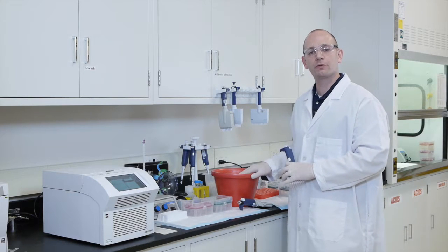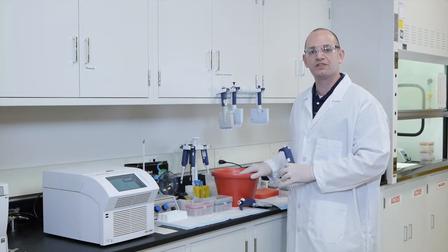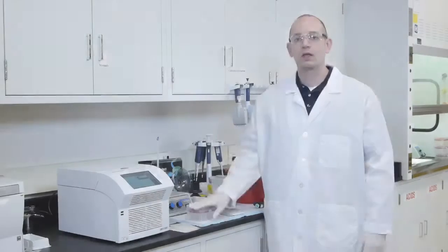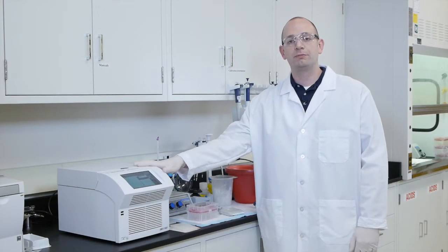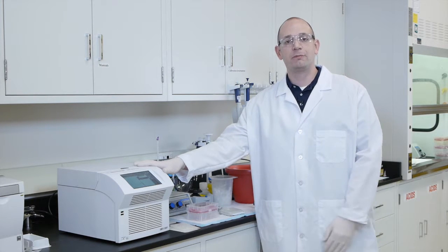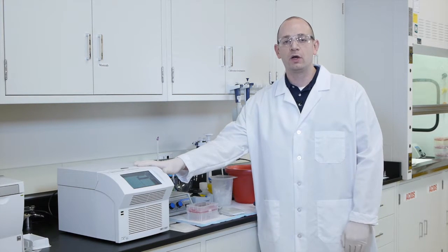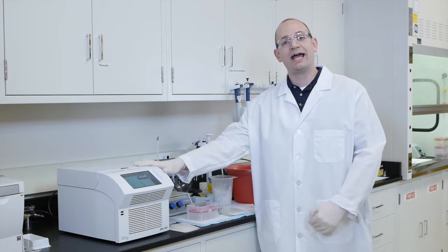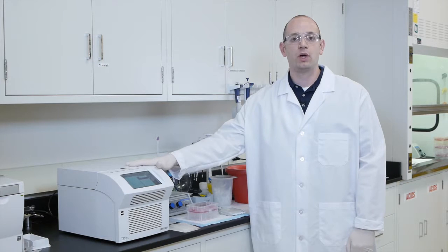Always make sure that your capture prior to being used for the hybridization is kept in an ice bucket to keep cool. So now that the hybridization buffer has been on the PCR machine and has come up to temperature for at least 5 minutes, we're now going to move on to the next part of the capture protocol, which is to add the capture library to the PCR machine as well to warm.